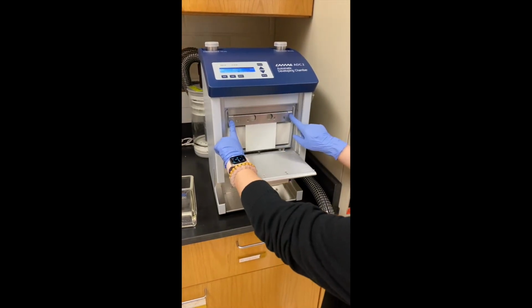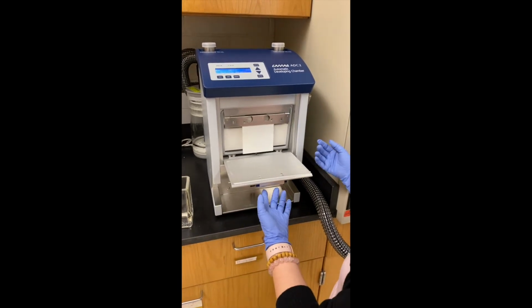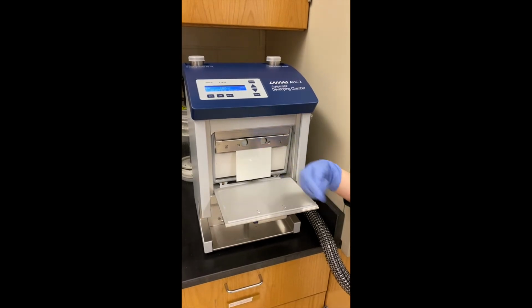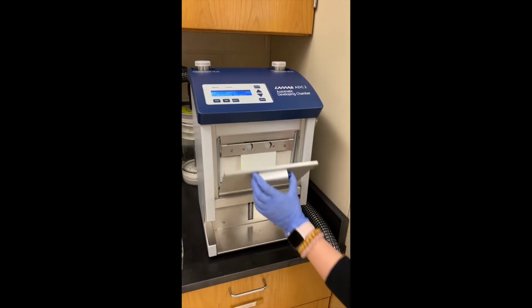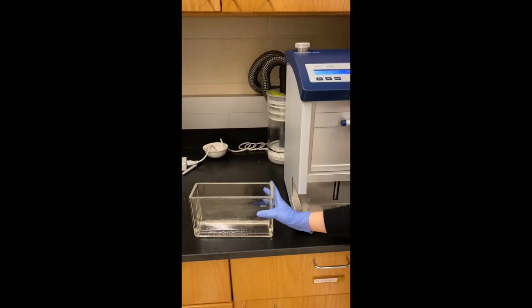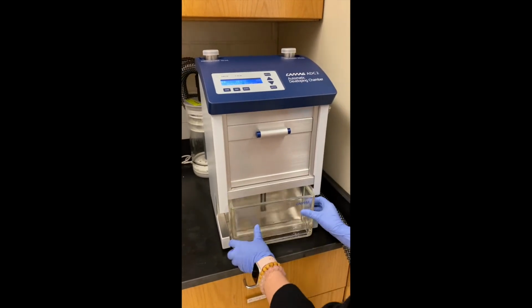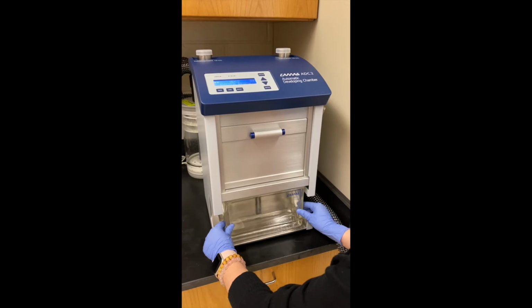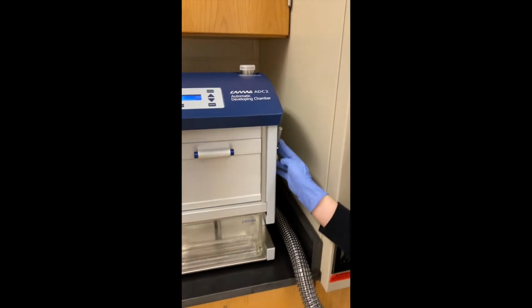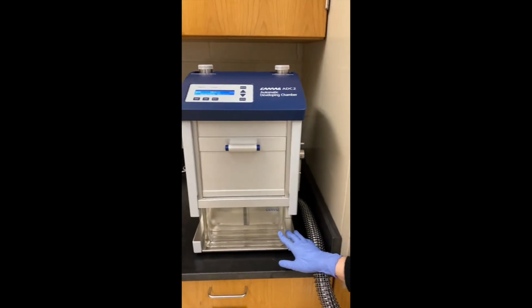So it's automatic. You don't need to actually put it in any position. It will directly get into it. And then just make sure the glass side is facing you outward, and then close it. And then the chamber is right here. So we would usually put the chamber in and make sure to push it all the way in. And then here is a lever. Just put it down so it seals the chamber.